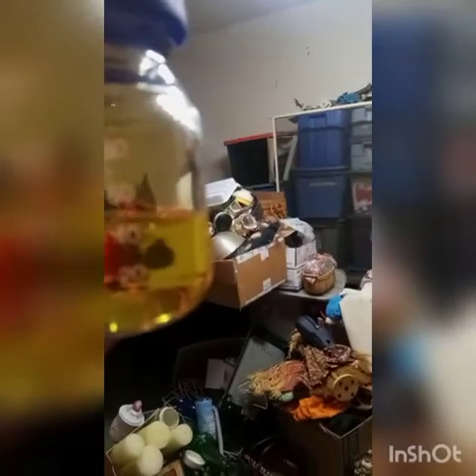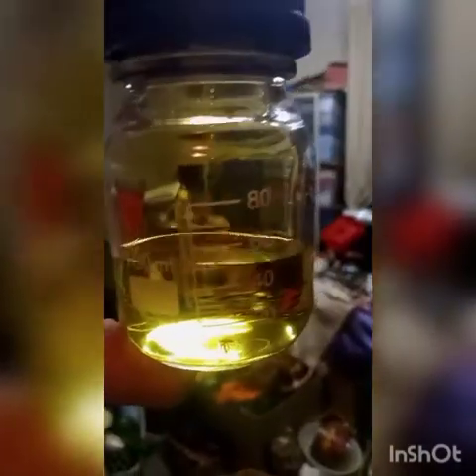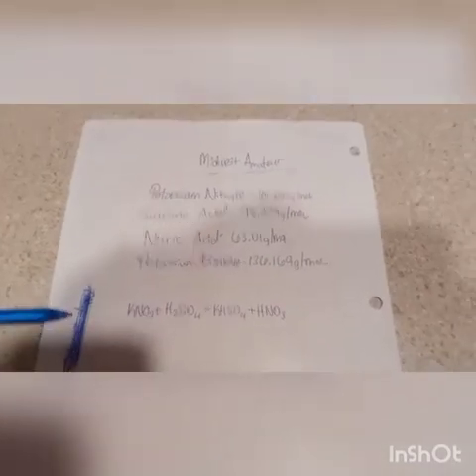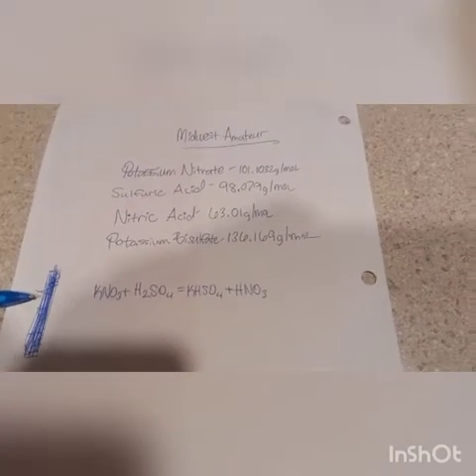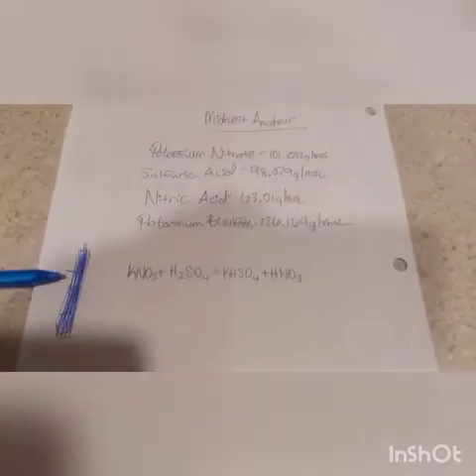The final product, I ended up with about 45-ish milliliters. So coming back, I'm not actually going to calculate my yield. You saw how much nitric acid was received out of that. It's going to be between azeotropic and 80%. I don't know. I didn't calculate. Literally just threw about 15 milliliters of water in and went on a 1 molar scale. So probably still going to be really potent.